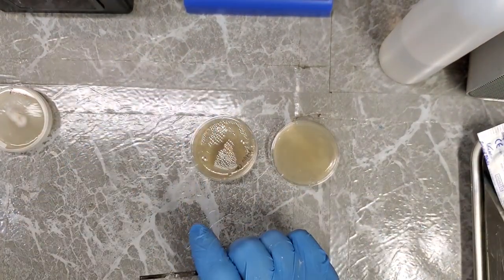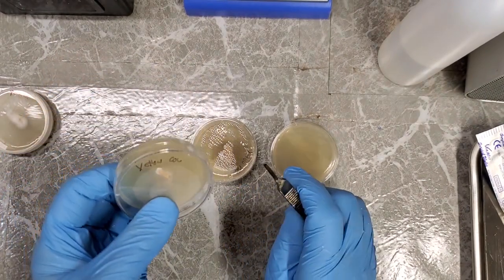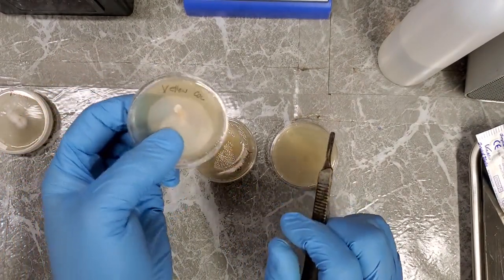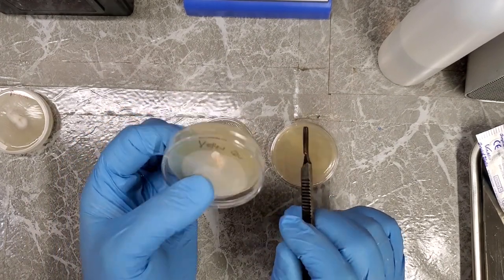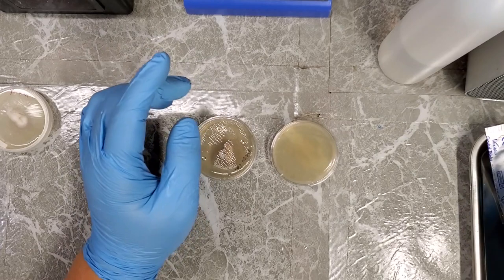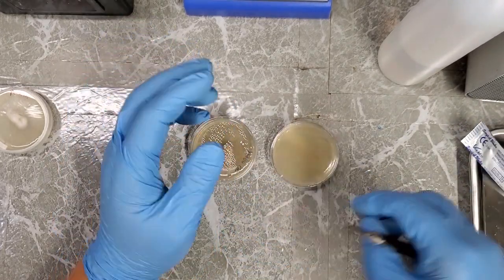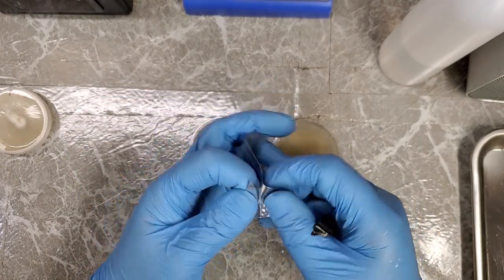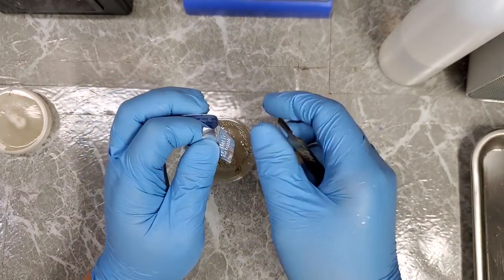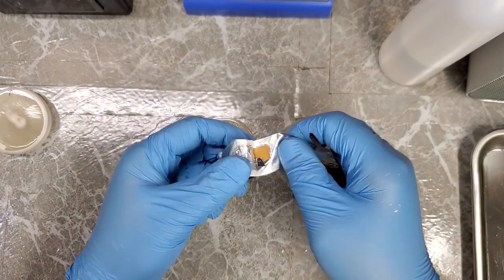But for the other petri dish, I am probably not even going to talk. I'll probably just do this one as quickly as I can so that I can make sure I get a good sample onto these other petri dishes. I'm not going to go into a lot of detail about how I do this because I've already done a video on how I do clones and tissue transfers and all that stuff. This is more about the practical application of isolating a mushroom culture from a contaminated petri dish.